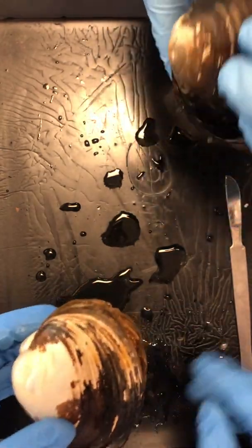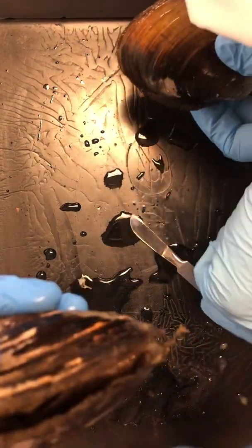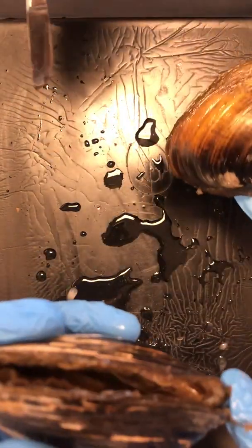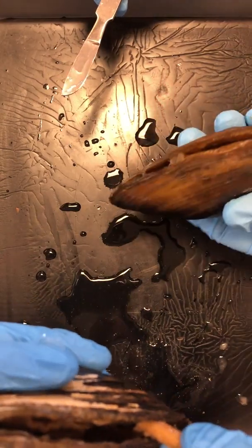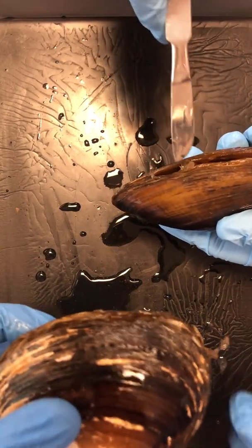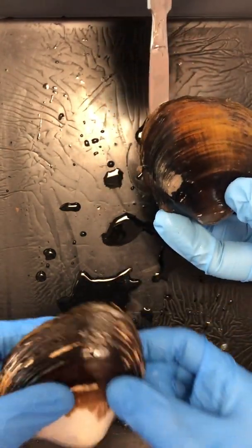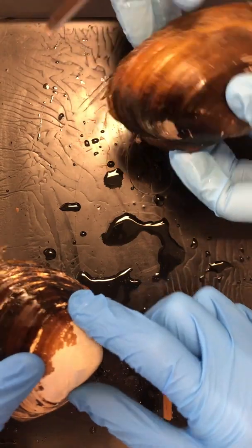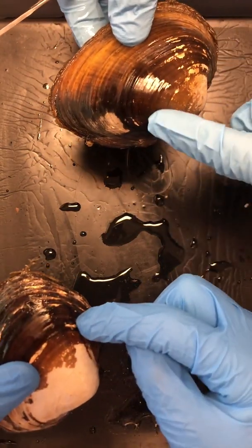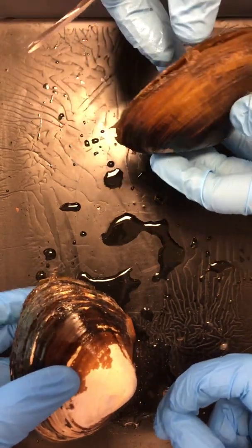What we're going to do to open this guy up, and Coach, you're going to need to make some decisions here. So your mussel has an opening here, and our Carolina people were nice enough to put a little stick in it to keep it pried open for us. The clam is held shut. This is not a clam, sorry, it's a mussel. These mussels are held shut by 2 internal muscles that are located on either side of the umbo. So there's a line of muscle here and a line of muscle here whose job it is to keep this guy nice and shut.